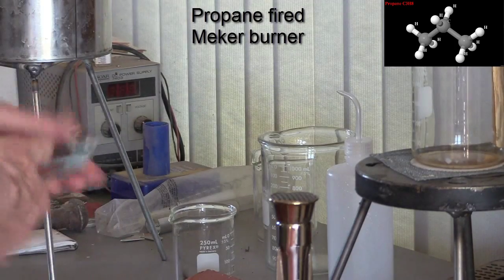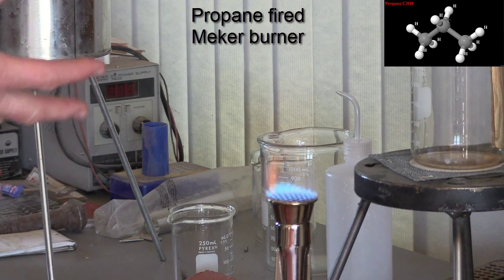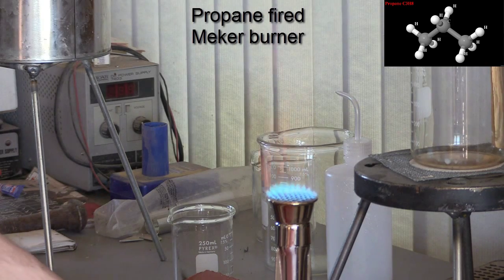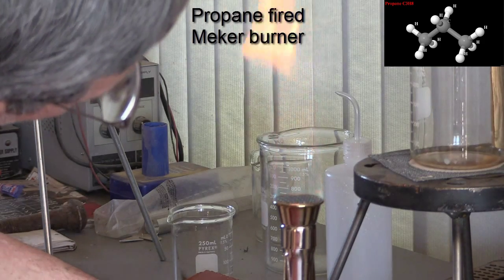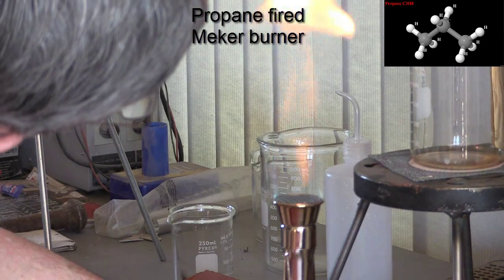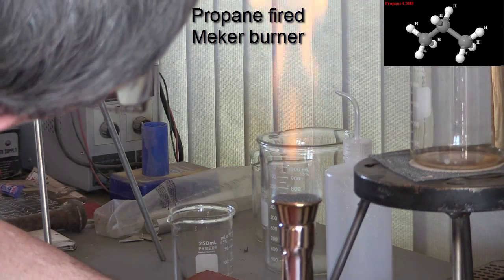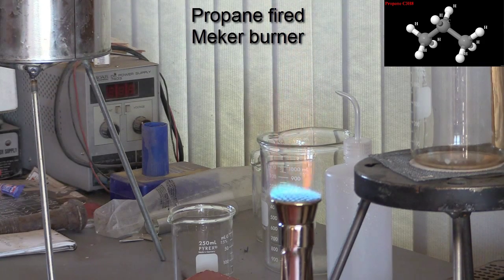I'm going to light this Meker burner. Now you can see there's a nice blue flame and some orange and yellow coming off of there from incomplete combustion. But watch what happens if I close off the air. See how the flame goes all yellow and orange? And I'm getting very incomplete combustion. And there's a lot of carbon coming off of there too. Now, as soon as I let the air back to it, I get that nice blue flame that indicates complete combustion. I didn't adjust the gas in there. All I was doing was closing off the airflow.